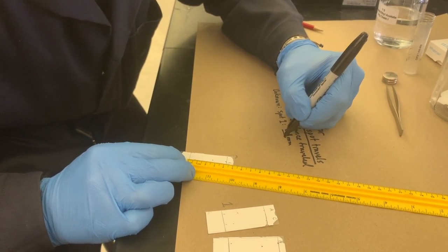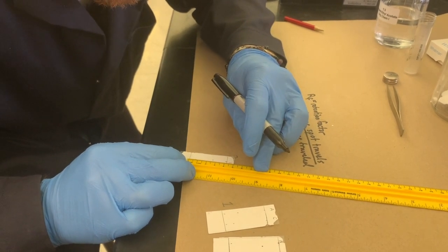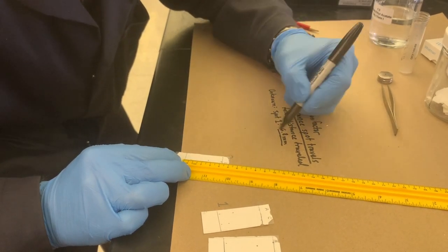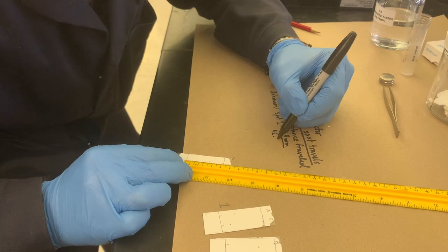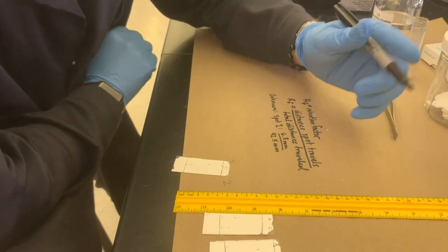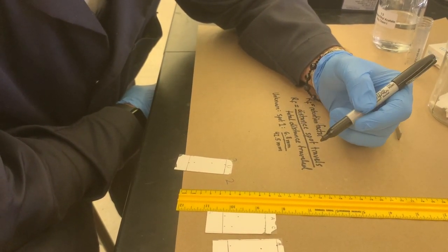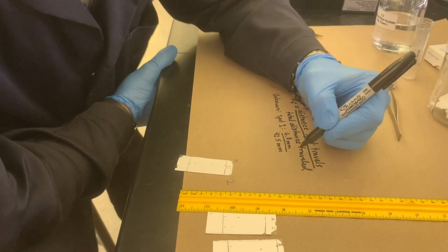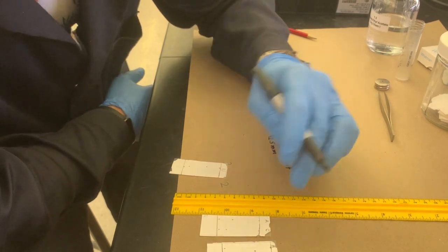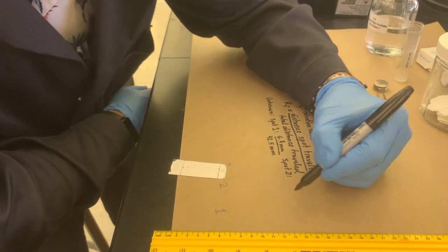millimeters over the total distance, which is about 42.5 millimeters. If you want to convert that to centimeters you can, but millimeters just happen to work better in this case for these plates. So if you have spot 2, which you do, you calculate that in a similar manner.